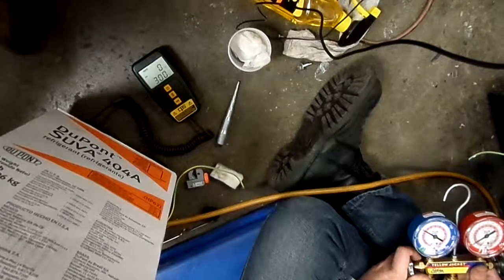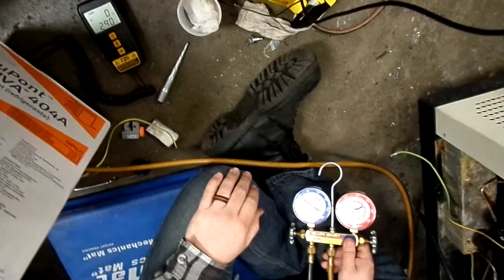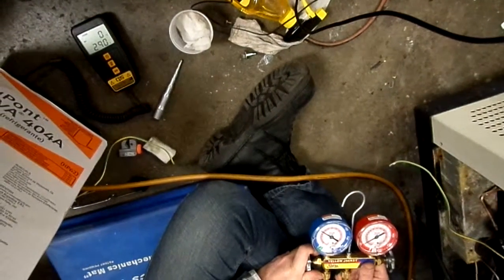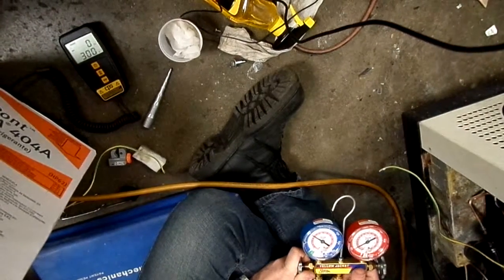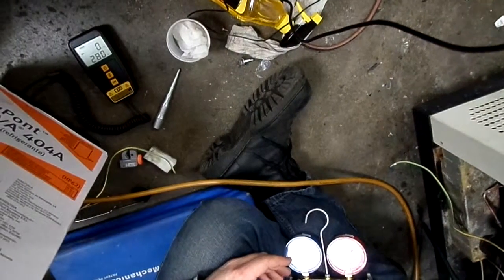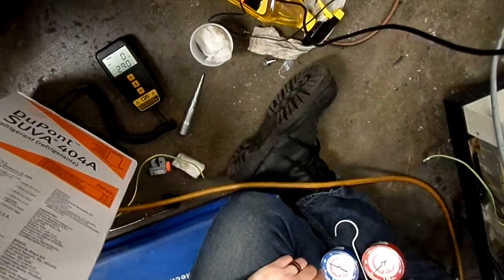Wow. 300. And now we plug in the machine and turn it on. What just happened? It just went to 290. Okay. It's 280. It's like good though. It's the hose or something.